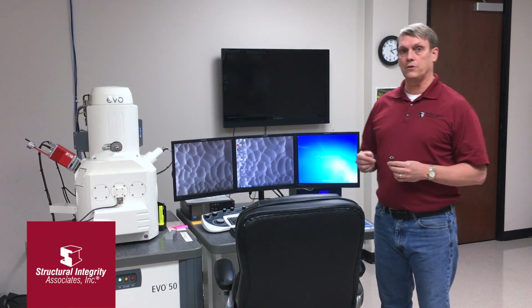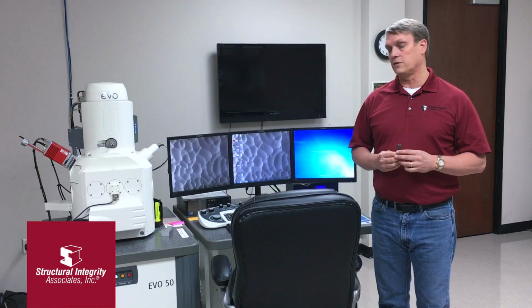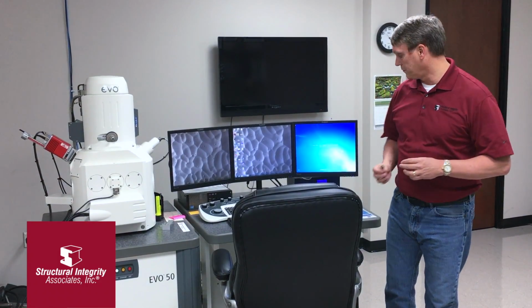For many of the failure analysis projects that we do, it's really important to do fractography and examinations using the scanning electron microscope. The SEM is capable of documenting fracture surface features up to about 4,000 or 5,000x, and it produces a really nice depth of field, so you get clear images even at high magnifications. In particular, it's indispensable for failure analysis in that it's very helpful in identifying the failure mode.